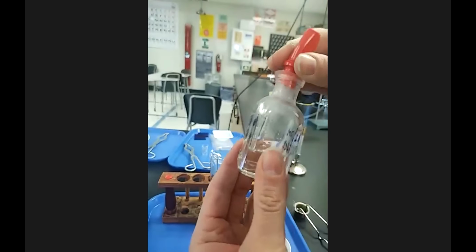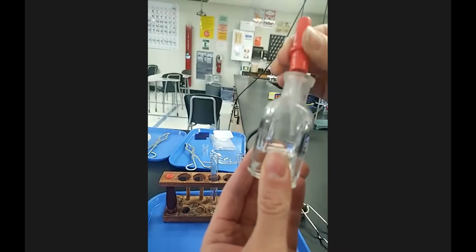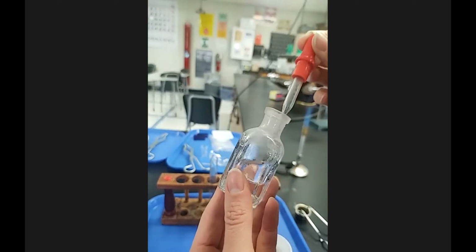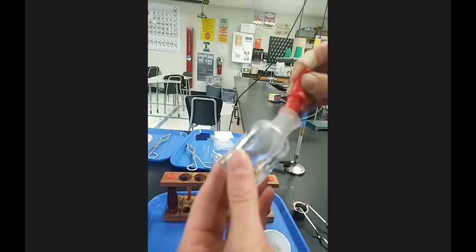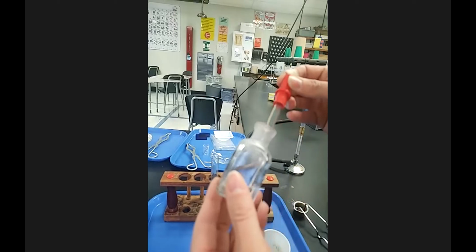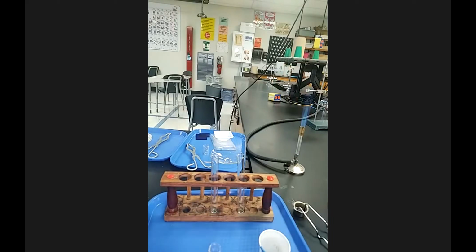And it does have a smell to it. It'll kind of tingle your nose if you don't waft it. Describing smells is not Miss Privet's strong suit, but if you don't know how to describe an odor, just describe it as a strong odor or a weak odor. And let me go grab a different dropper. This one was not working the best earlier. Different one here.